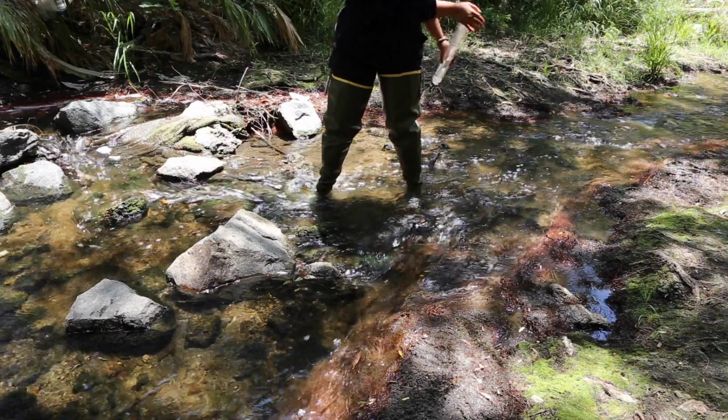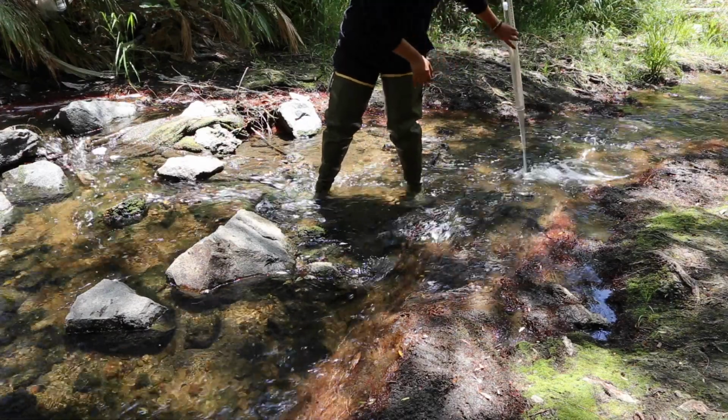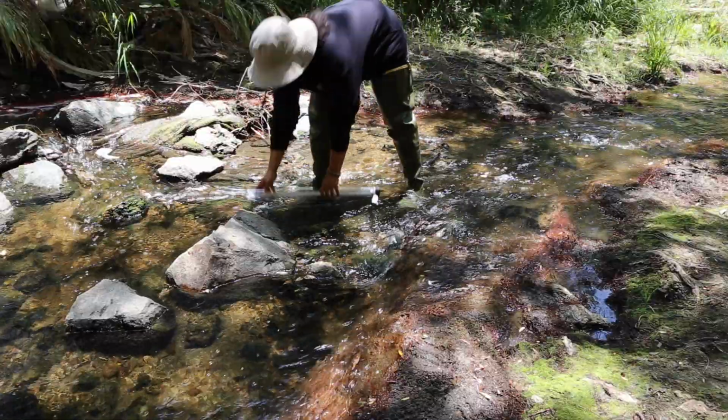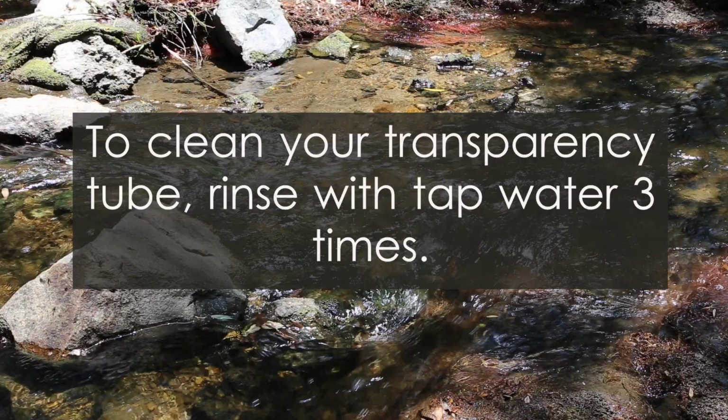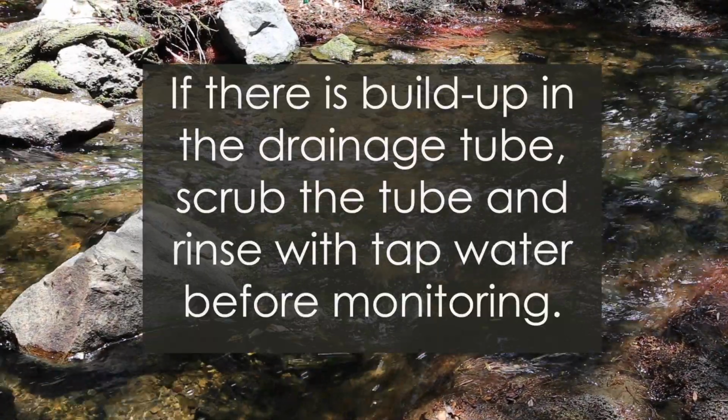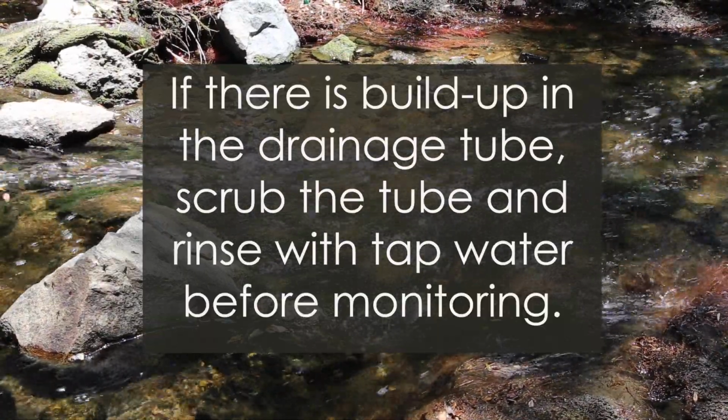Once you have recorded your values, pour the water out of the transparency tube. You do not need to acid wash the transparency tube. You may want to rinse your tube at home with tap water to remove any sediment.